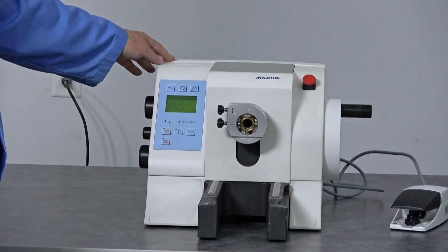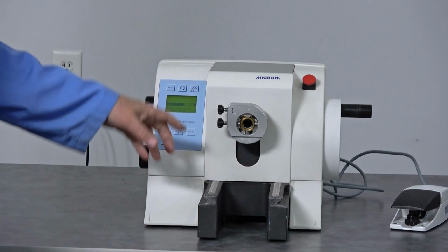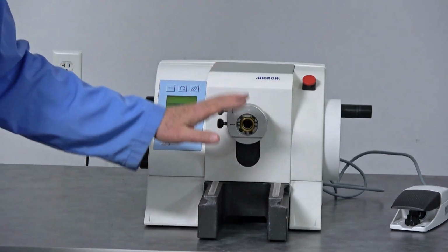Menu works fine. Everything just seems to be, other than those two items, a full disassembling and clean of that mechanism and re-lubrication would probably take care of it.